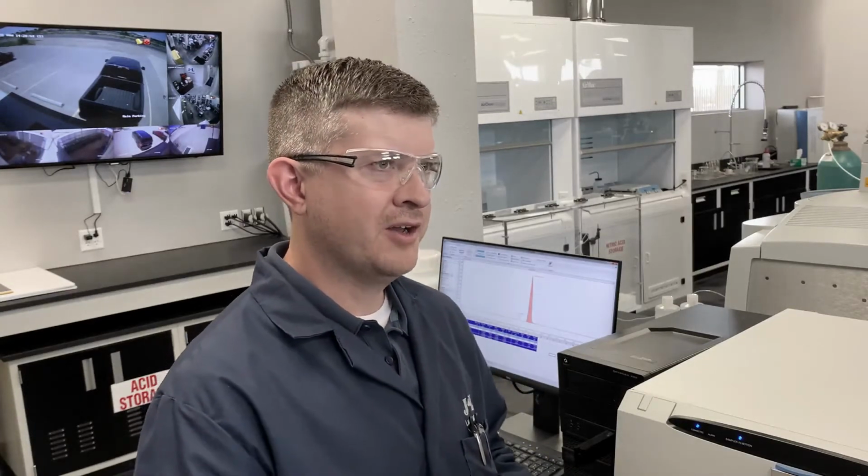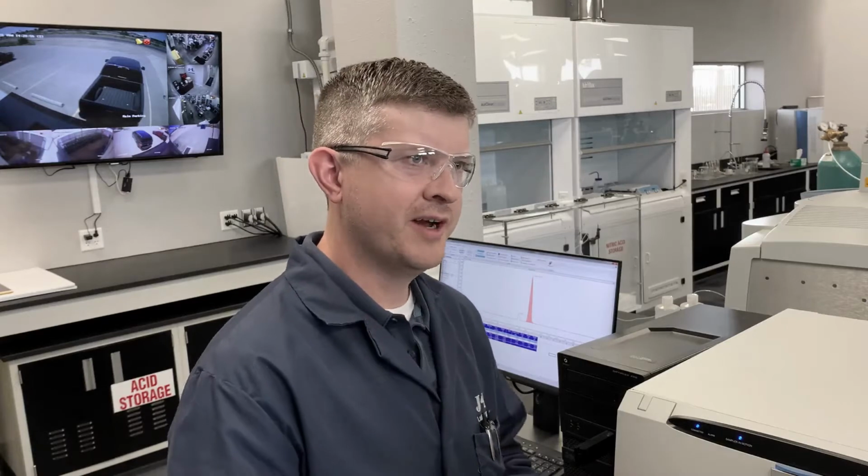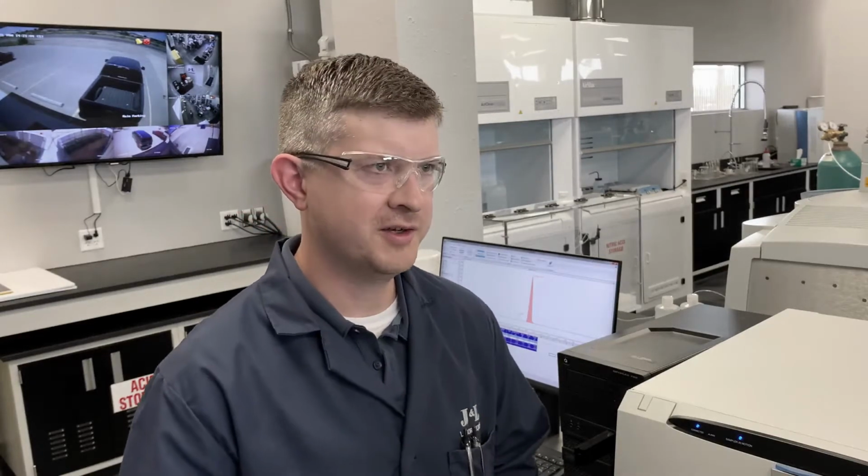The four primary ones that we scan at J&L are acetate, formate, propionate, and butyrate. These are then equated back to their acid forms, being acetic acid, formic acid, butyric acid, and propionic acid. After we analyze the samples, we're able to actually speciate between the four different organic acids. We'll plug them into a formula, and it's going to equate them to total carboxylic acids.